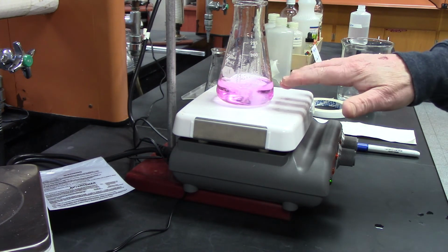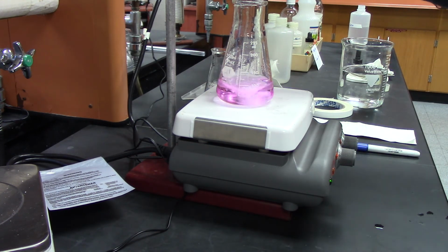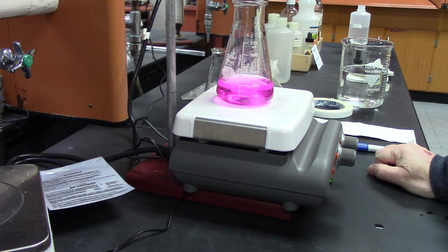And the color is kind of, you can get it really pink. I'll add a couple more drops, but I'm done. I'll show you that you can get it even pinker. All right, and you just have to decide what pink you're going to get. Okay, so that's maybe too pink, but that's one thing kind of bad with this coloring to figure out when you're done. It's more qualitative than quantitative. But that's what we're going to use for this one.